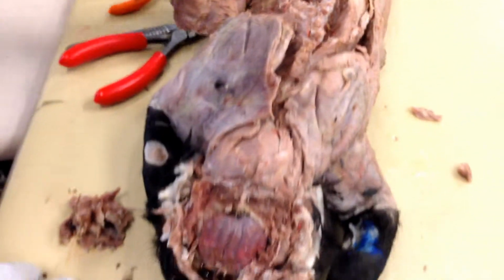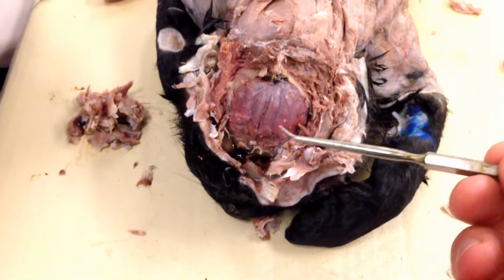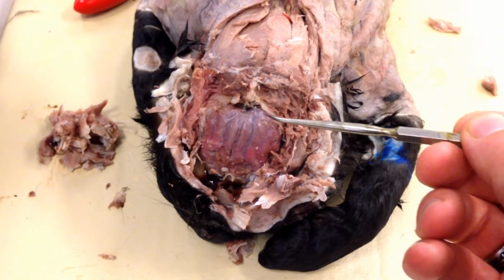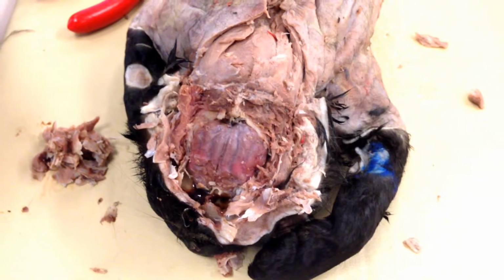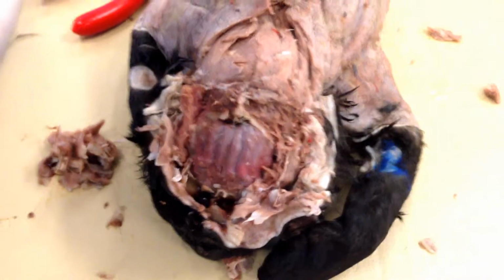And 59, yay! What is this mass of soft tissue up here? That's inside the head, in case you can't tell. Awesome. 59 is a weird place to leave questions, so we'll just do number 60. Did you have fun? Okay.